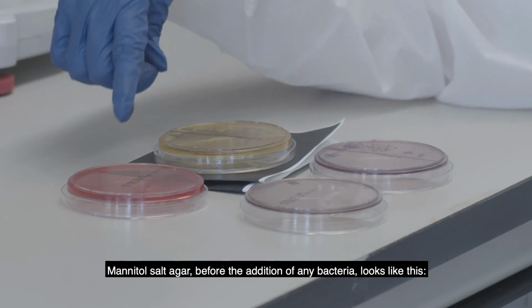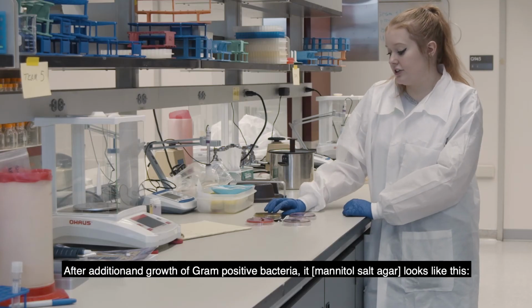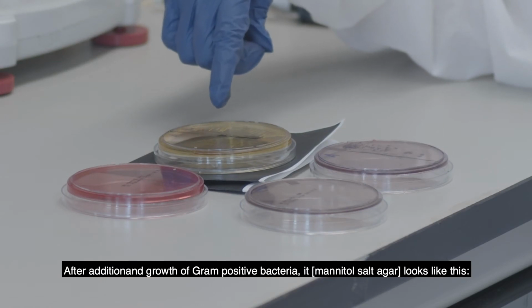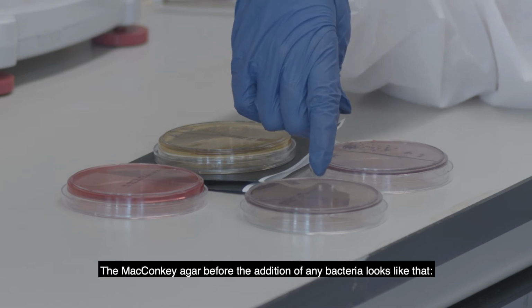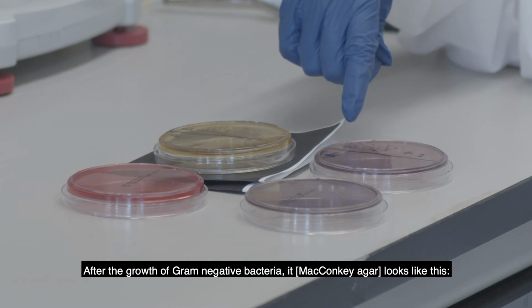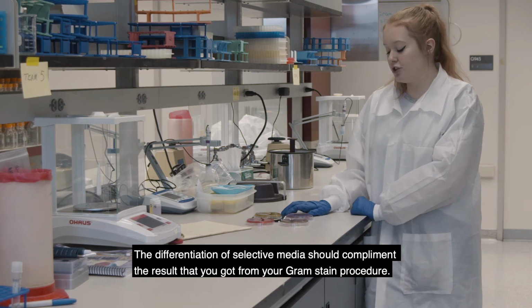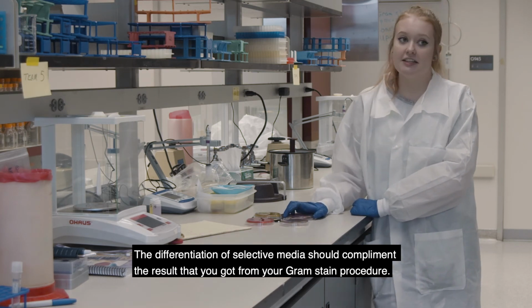So the mannitol salt before addition of any bacteria looks like this, and then after addition and growth of gram-positive bacteria, it looks like this. And the MacConkey agar before addition of any bacteria looks like that, and after the growth of gram-negative bacteria, it looks like this. So the differentiation on selective media should complement the results that you got from your gram stain procedure.